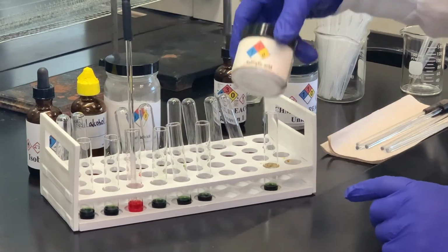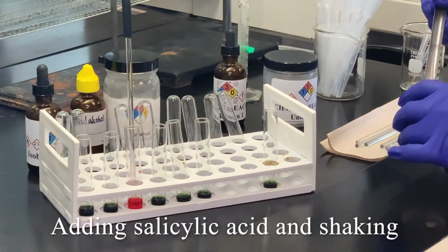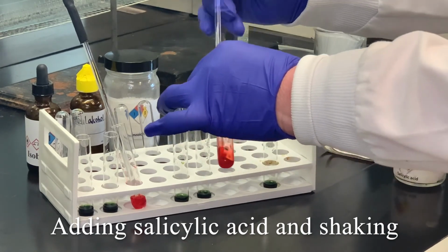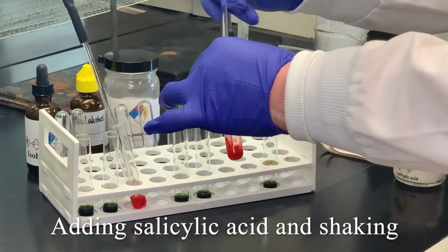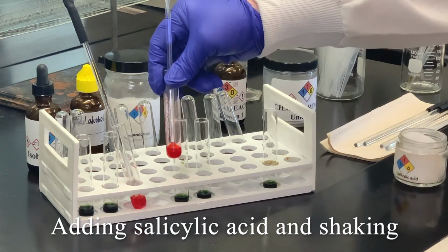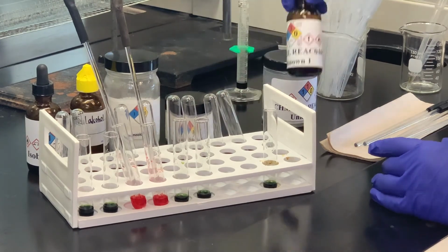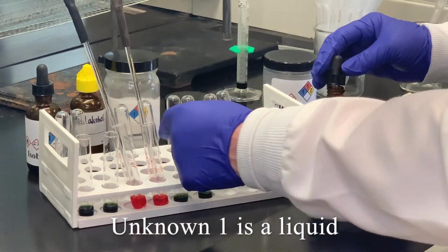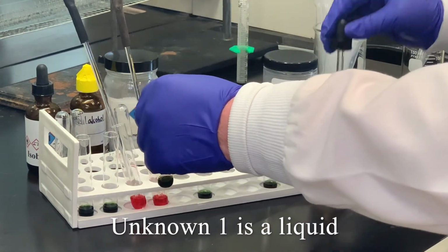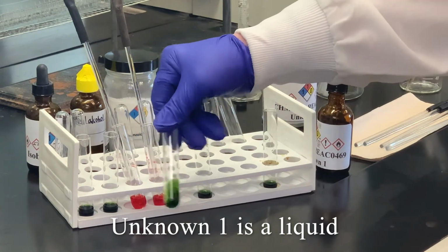The next compound is salicylic acid. And notice we've had two acids, both of which are changing to roughly the same color there. And then what we have are two unknowns. Our first unknown is a liquid. So I'll add a drop or two of the unknown to our universal indicator.